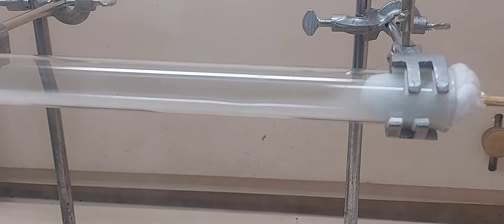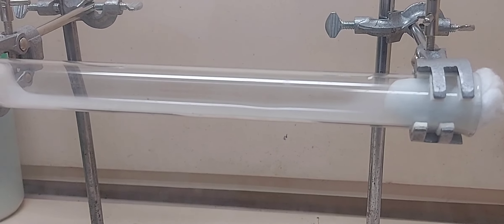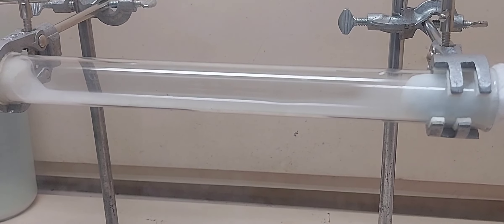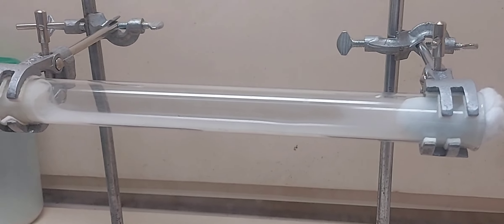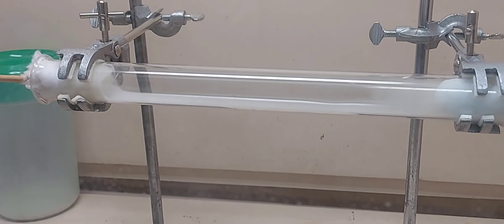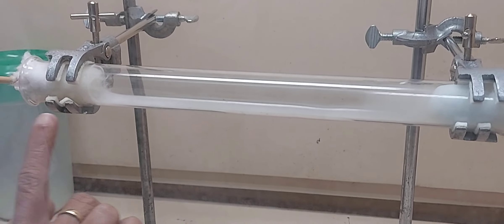No. It's not smoke. It's not smoke actually. The two substances are ammonia and HCl. You saw the fumes of HCl traveling.